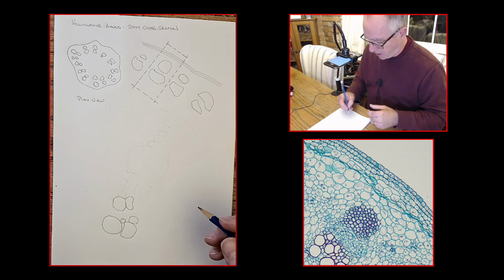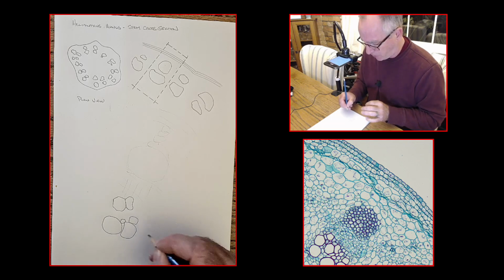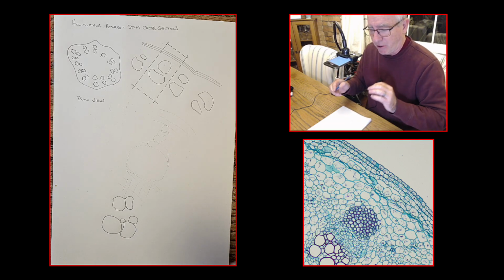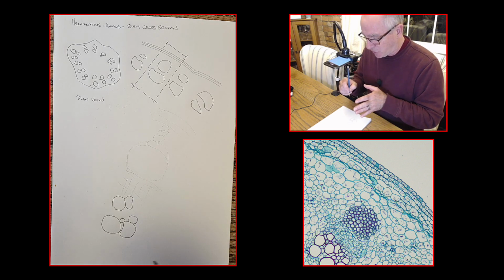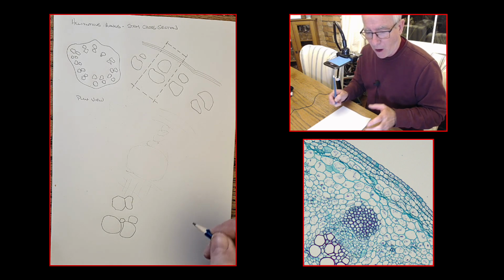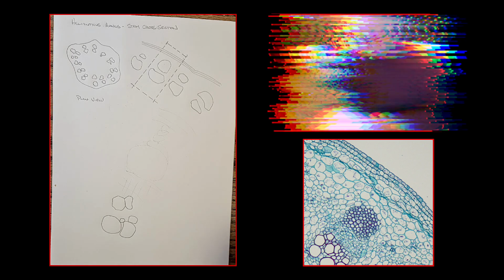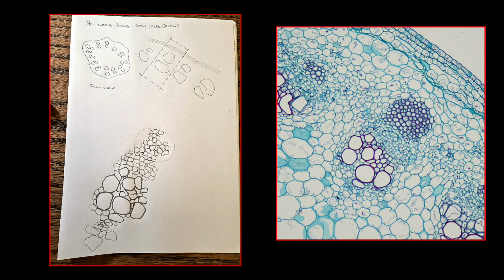Now what I'll do is I'll start drawing them and I'll bite my tongue and I'll take my time and I'll sweat over it and I'll make a drawing that's as good as I can get. But instead of occupying all of your time, what I'll do is I'll just make sort of time-lapse images as I go along while I'm doing the drawing. So wish me luck. Let's see what happens. Okay, well, there you go.